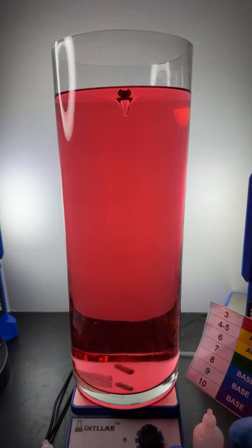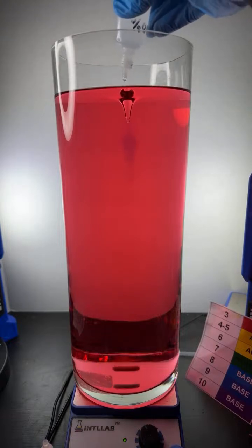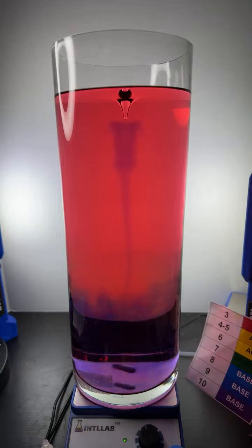What have I got? Acid over here. Let's add the base here. Sodium hydroxide base. Let's see what happens when I start adding. There's a drop. There's a second drop. There's a third drop. I certainly see a line of blue color developing. It's kind of pretty.